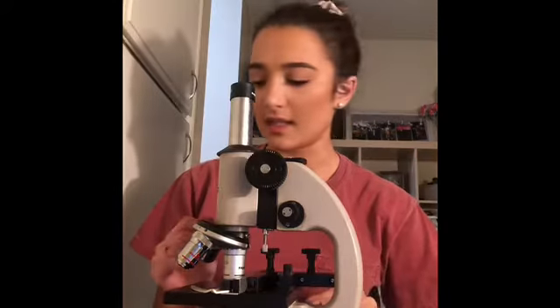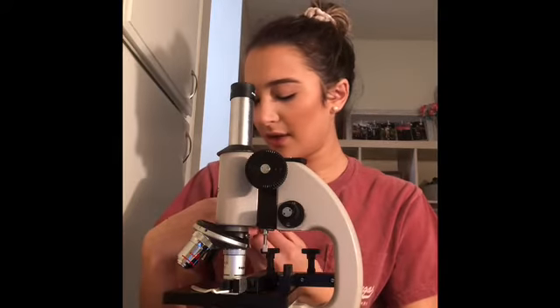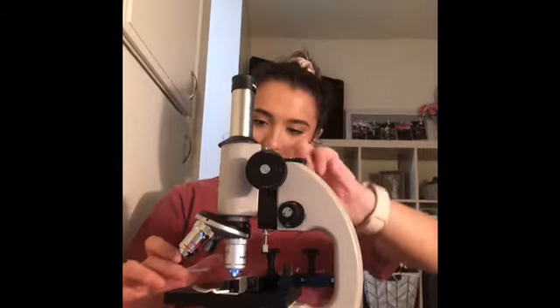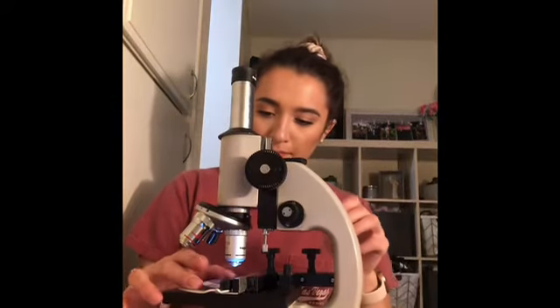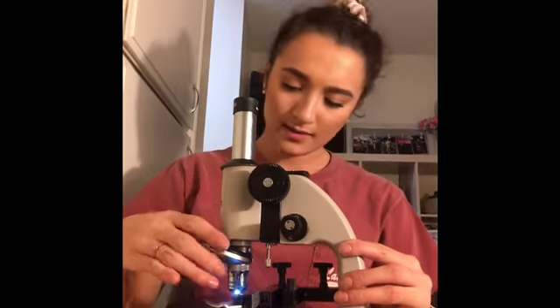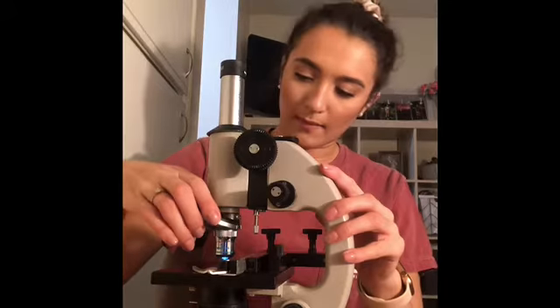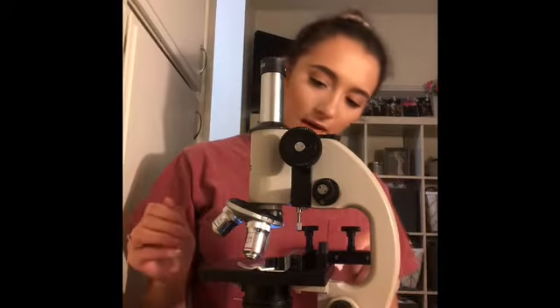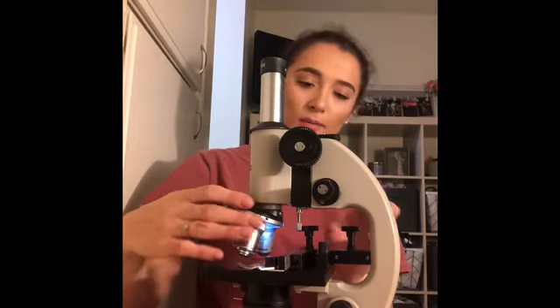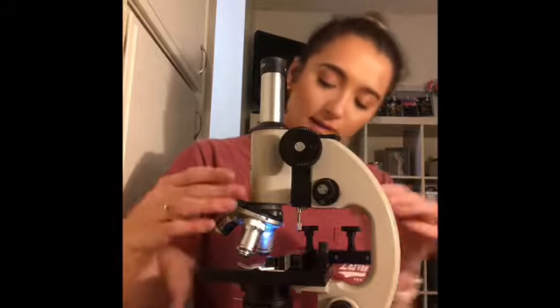I've taken off the slide, and now I'm going to change it to the Coccus form. I'm going to place that on my microscope. So I have found that. Now I will switch to my low power lens. Now I will switch to my high power lens. Now I'm on my final lens. I'm on the oil immersion lens. I already put 1 drop of immersion oil on the slide.